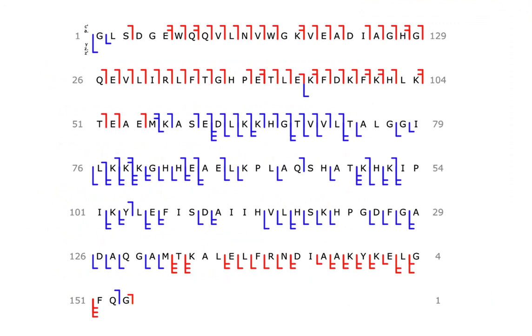And that results in a graphic like this that you can then use for posters, presentations, talks, etc.